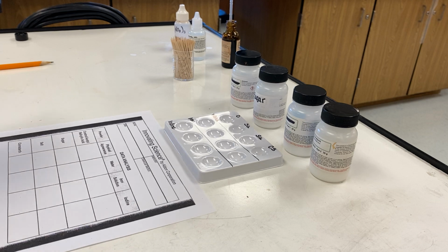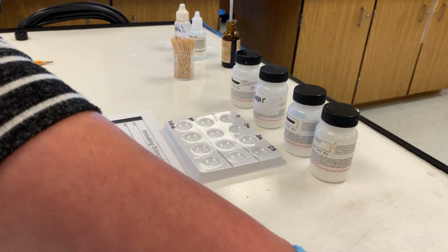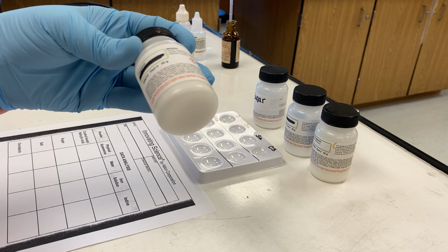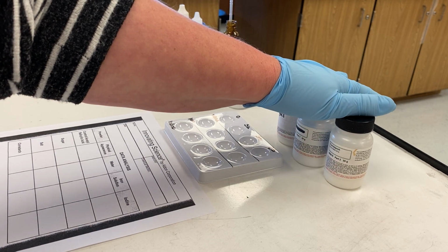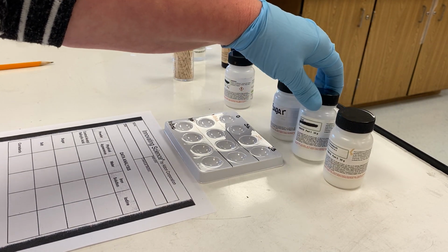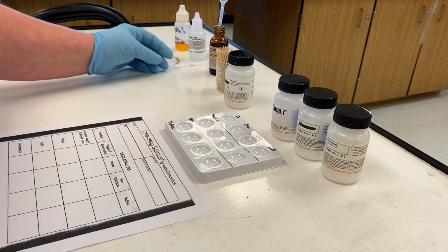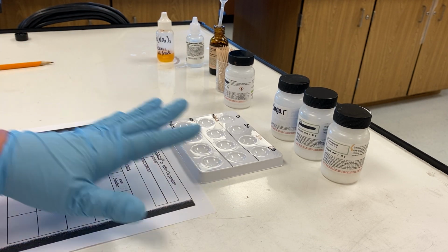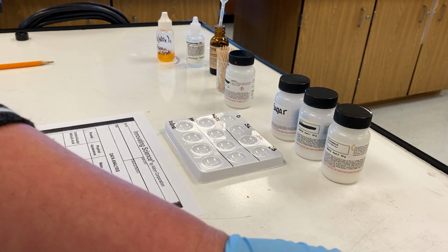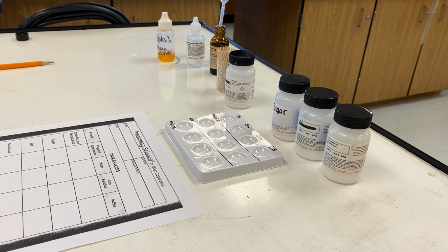So what we have with us today, we've got a few different things. The first thing we have is the actual control. So this is aspirin crystals. Then these are samples of the items confiscated from the cafeteria. So we have sugar, we have salt, and we have cornstarch. We also have some chemicals here. We have Lugol's iodine. We also have a ferric nitrate. We also have sodium hydroxide. Those we're actually going to be using today to determine which one contains the aspirin. The reason why that is so important is because if the aspirin is present, when certain chemicals react with it, it will turn the color that we're looking for.